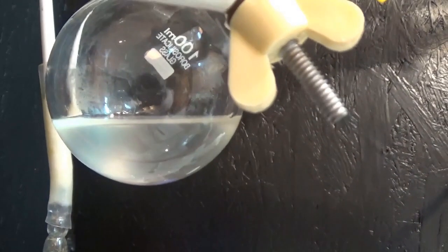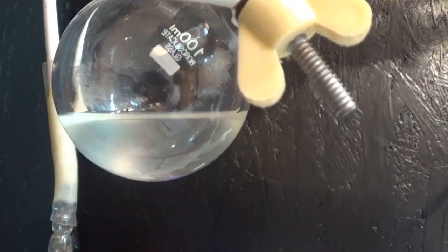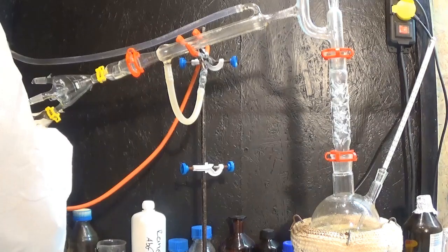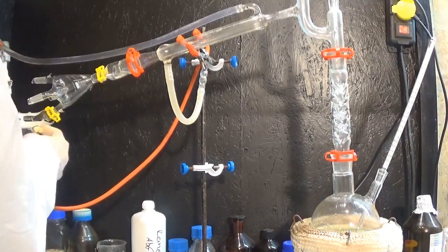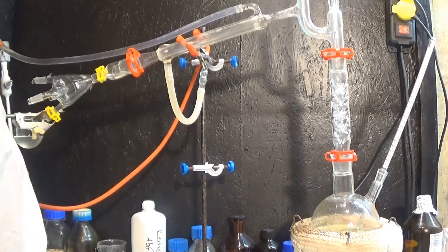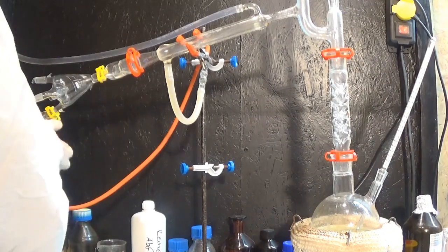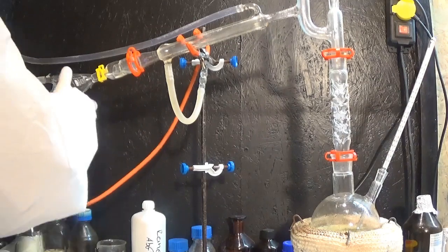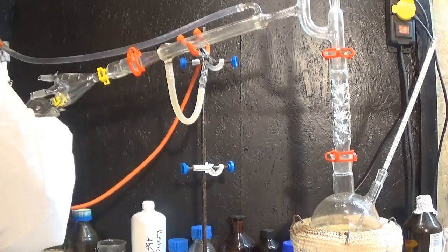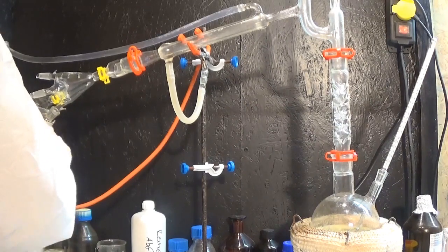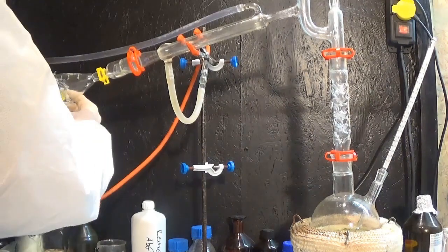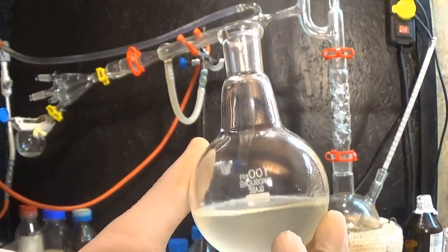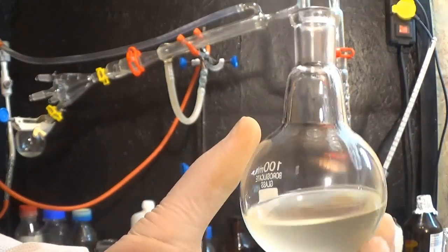The presence of water makes the collected fraction cloudy, but it is not enough water to form a separate layer. I chose a setup where I am using a distilling spider which normally is used with all the NS14 sleeves connected to single neck round bottom flasks, but halfway through the construction of the apparatus I noticed that I am out of NS14 connector clips to secure all of the flasks. So I just went with one flask at a time and changed them out when I wanted to collect another fraction. The first fraction I wanted to collect was from 40 to 65 degrees C, so when the thermometer reached 65 I swapped the flask out and continued distilling.